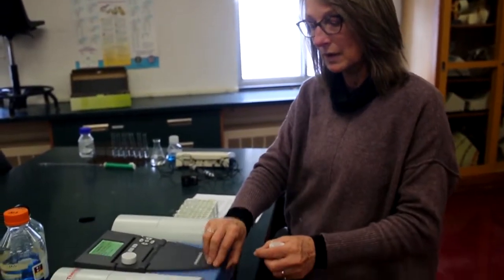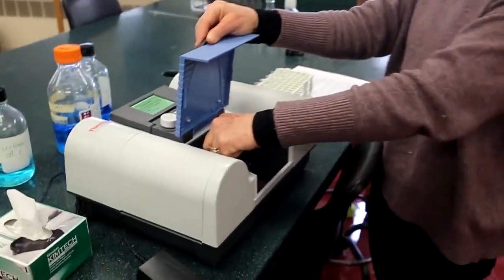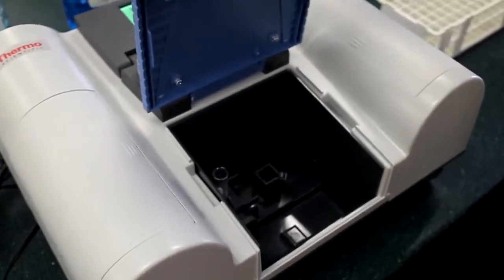So two things to remember: always make sure your test tube is clean. Always remember it goes in the right compartment in the instrument so that the light beam can go through it properly.